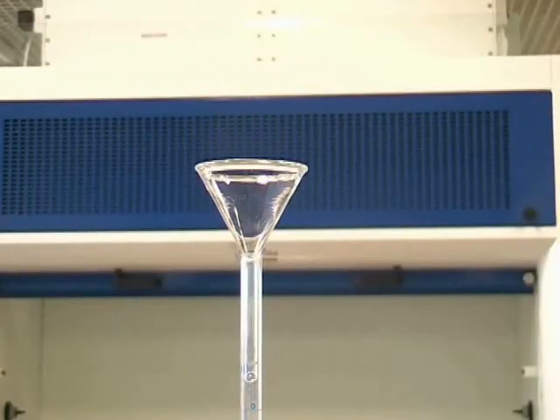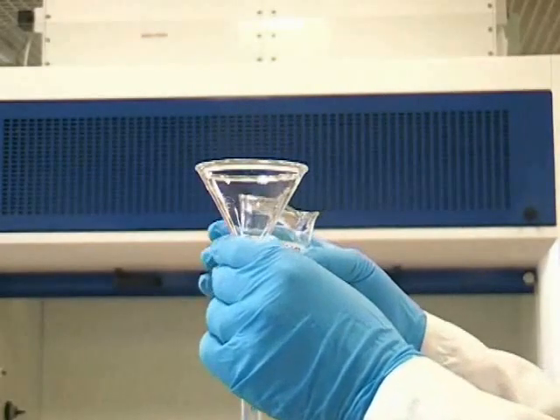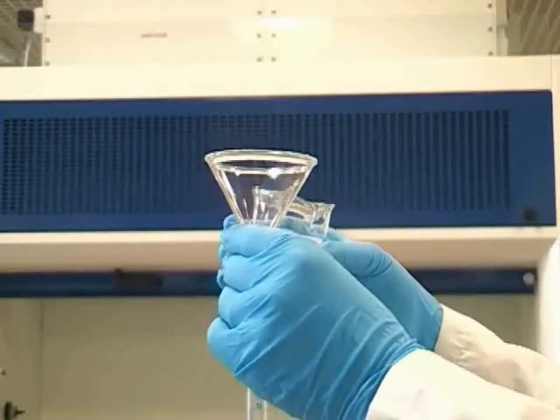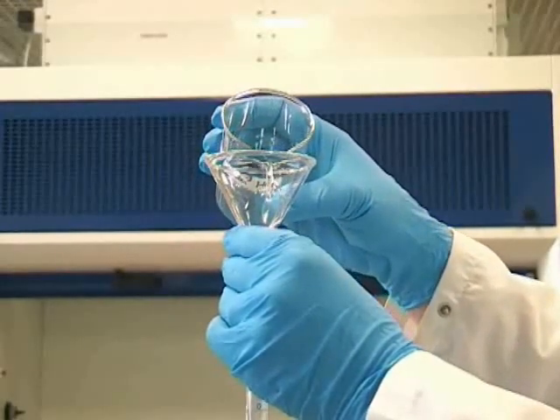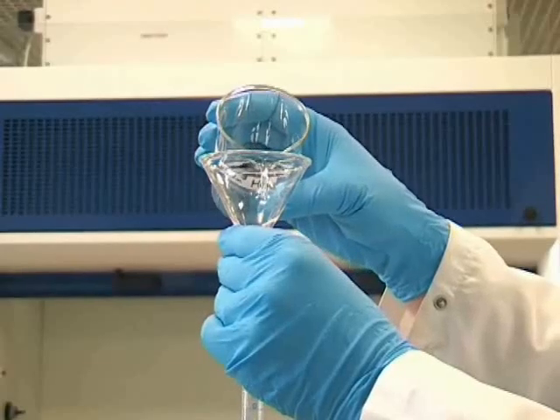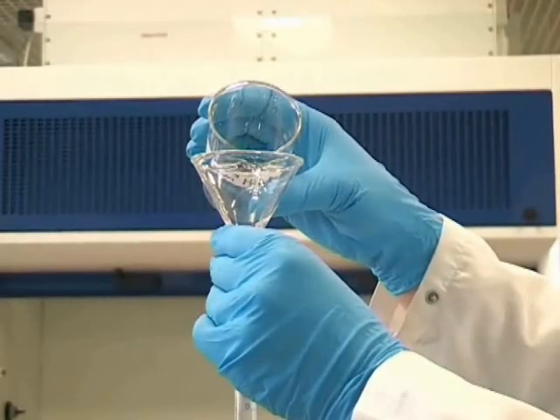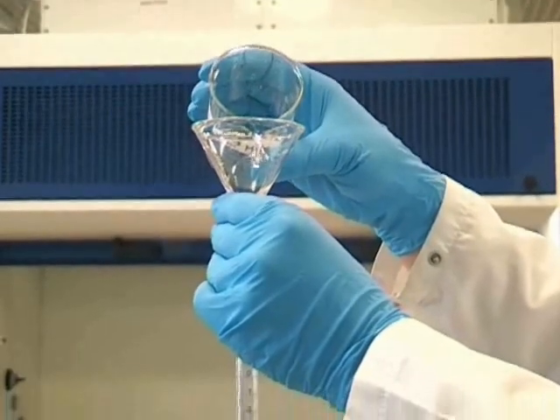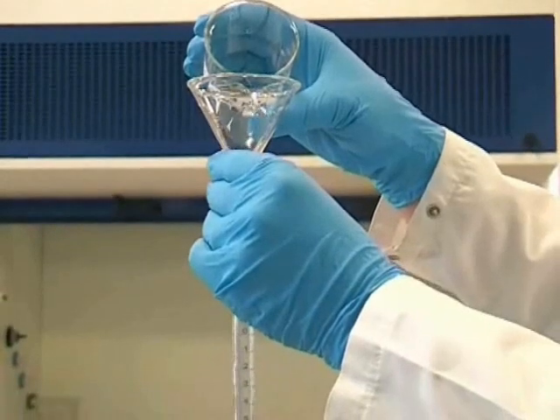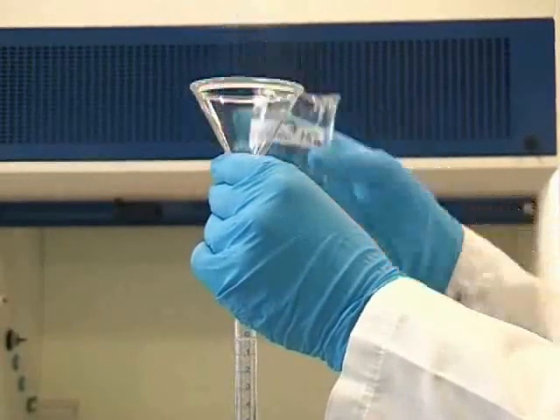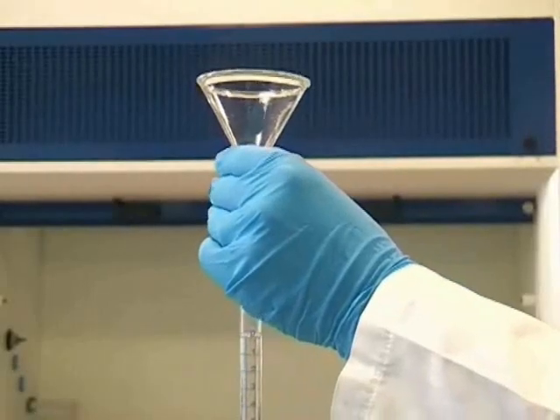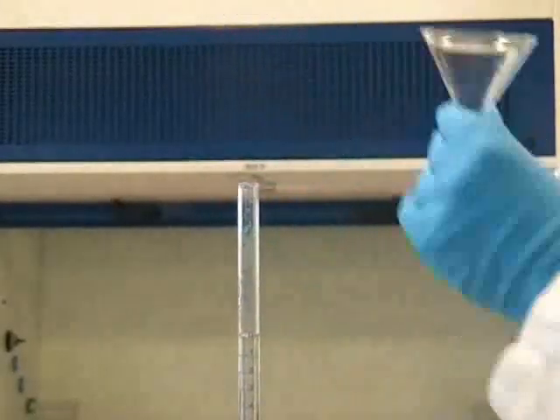After checking the tap on the burette is closed you can proceed to fill the burette. It's sensible to lift the funnel out slightly as this prevents spluttering of the solution. It's not essential to fill the burette to the zero line although you must make a note of the burette reading for later on.